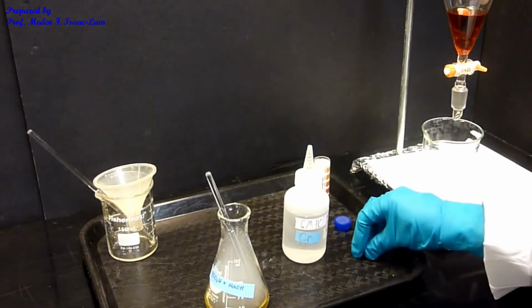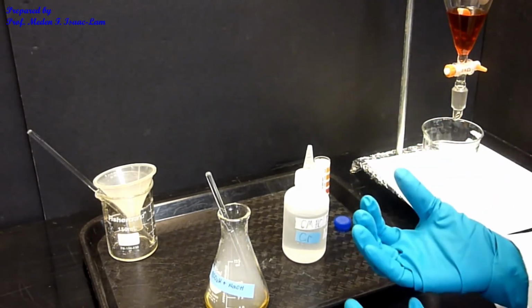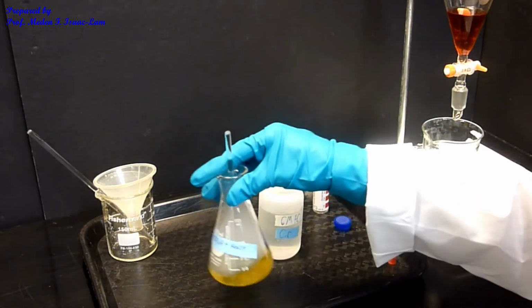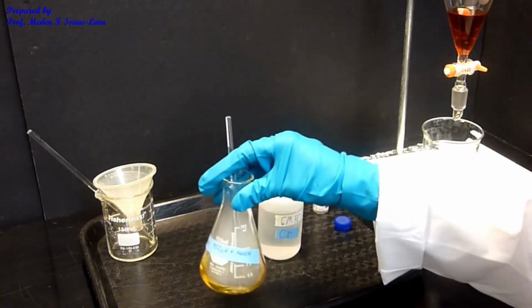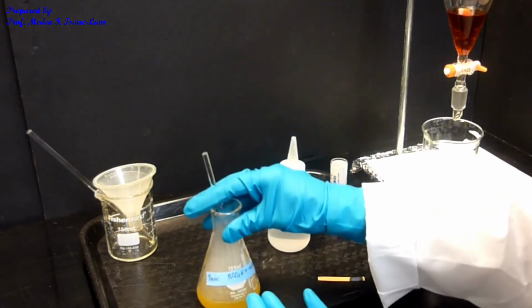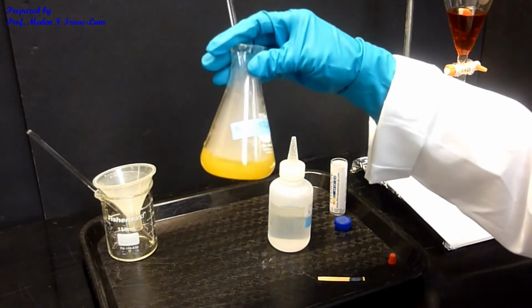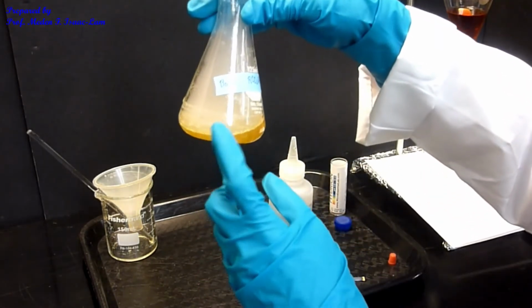Take note that I'm not really measuring it. I know that I added enough when I form back the precipitate. So I want that precipitate to stay. So I'm seeing some cloudiness, but I want it to stay. That means that if it's not staying, I have not added enough acid yet to precipitate everything. I want the solution to be acidic, but I don't want to add a lot of the acid and then waste it. So I just want a little bit more than enough so that that precipitate stays. So I can see already some precipitation.